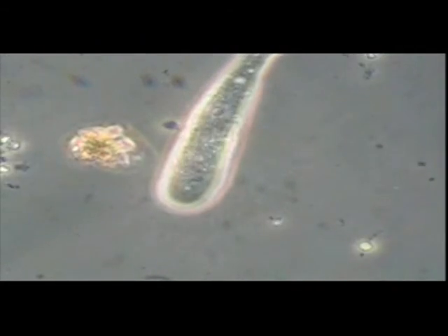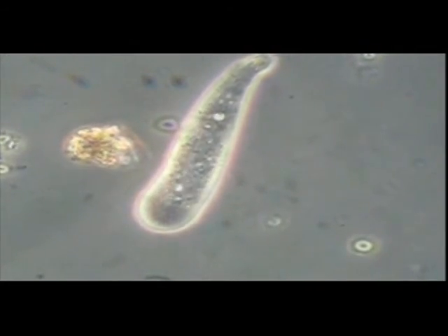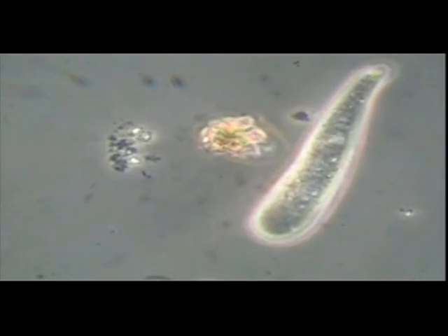The next amoeba is a species of sac amoeba and is clearly moving much more rapidly than the previous one. It is monopodial. You can see a central nucleus, a posterior contractile vacuole, and many refractile bodies in the protoplasm.